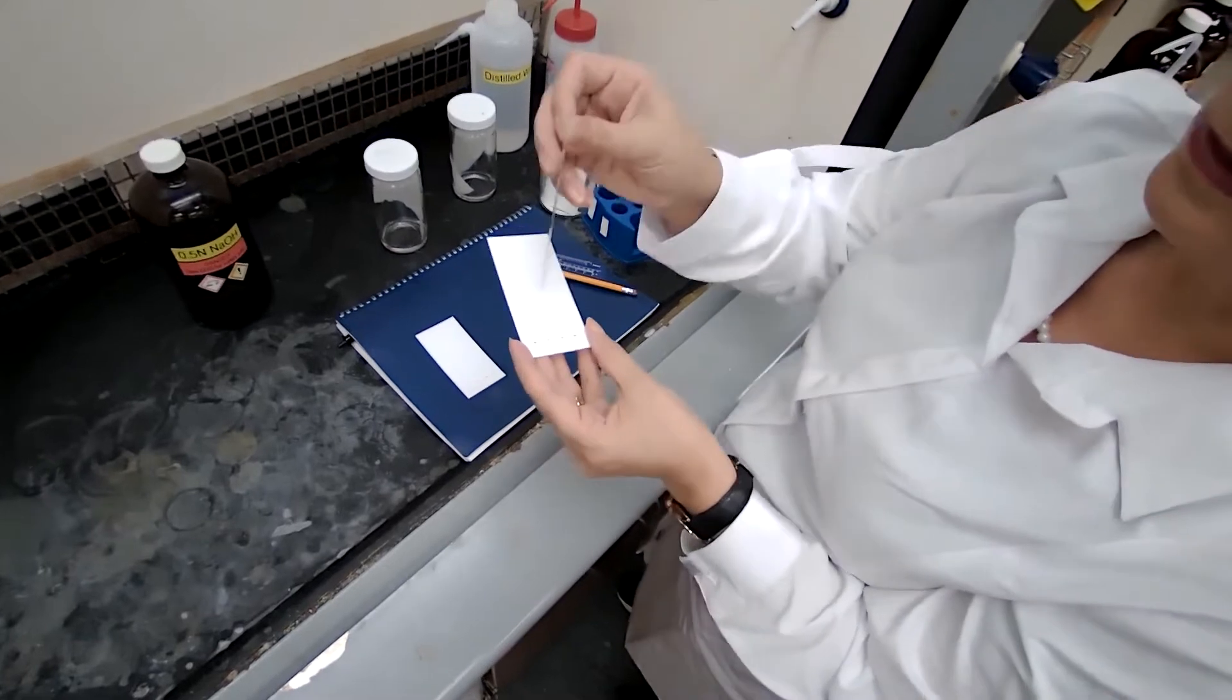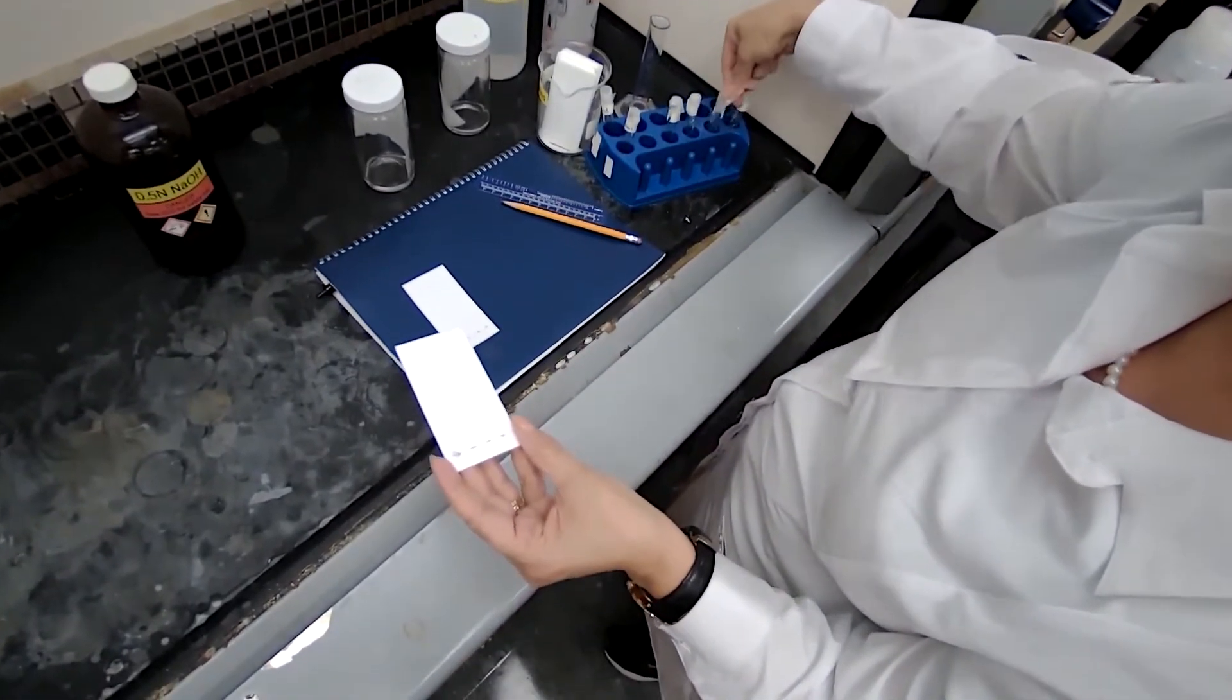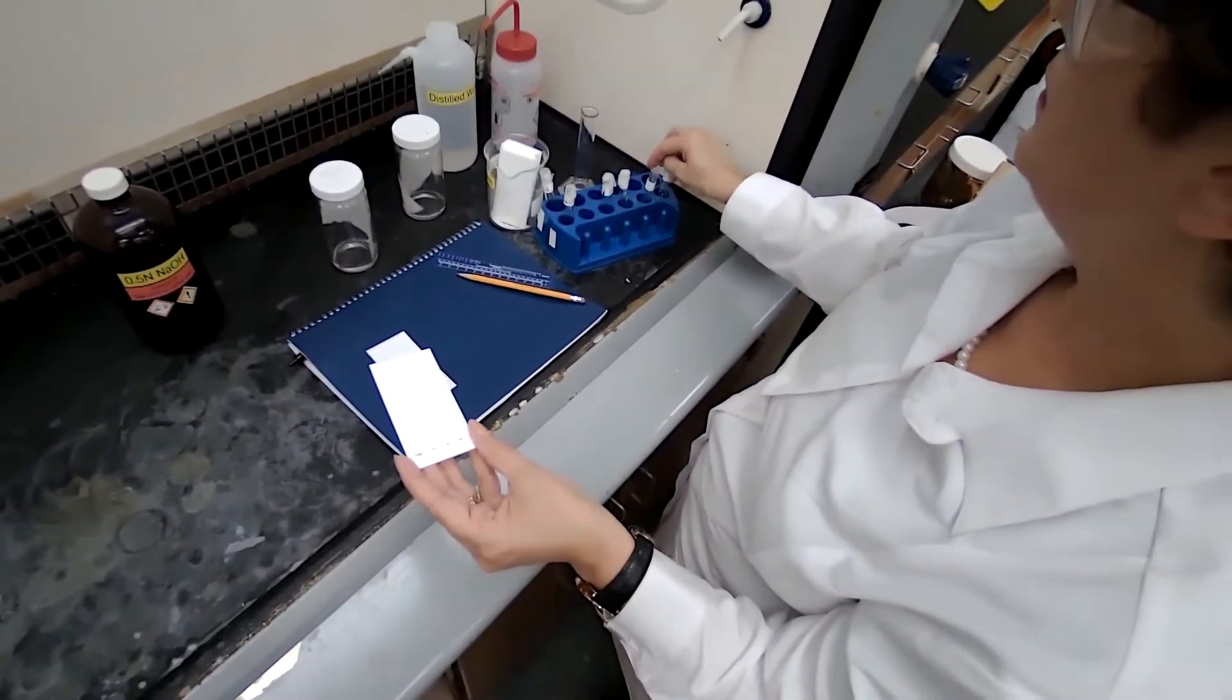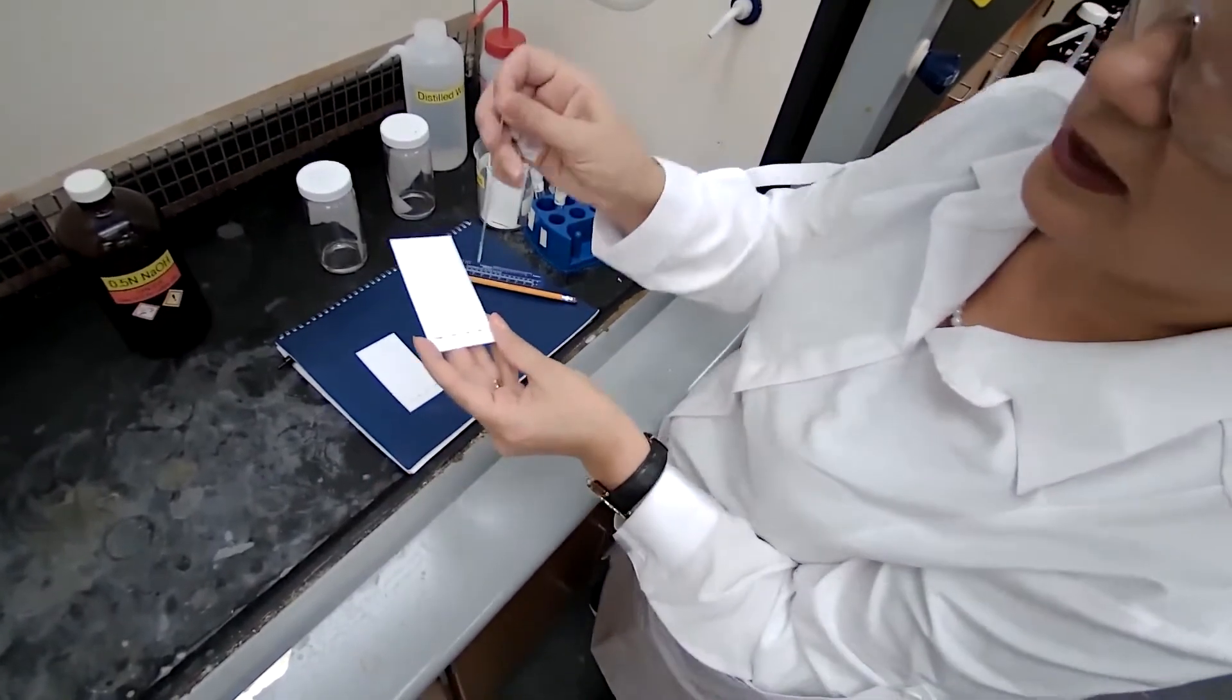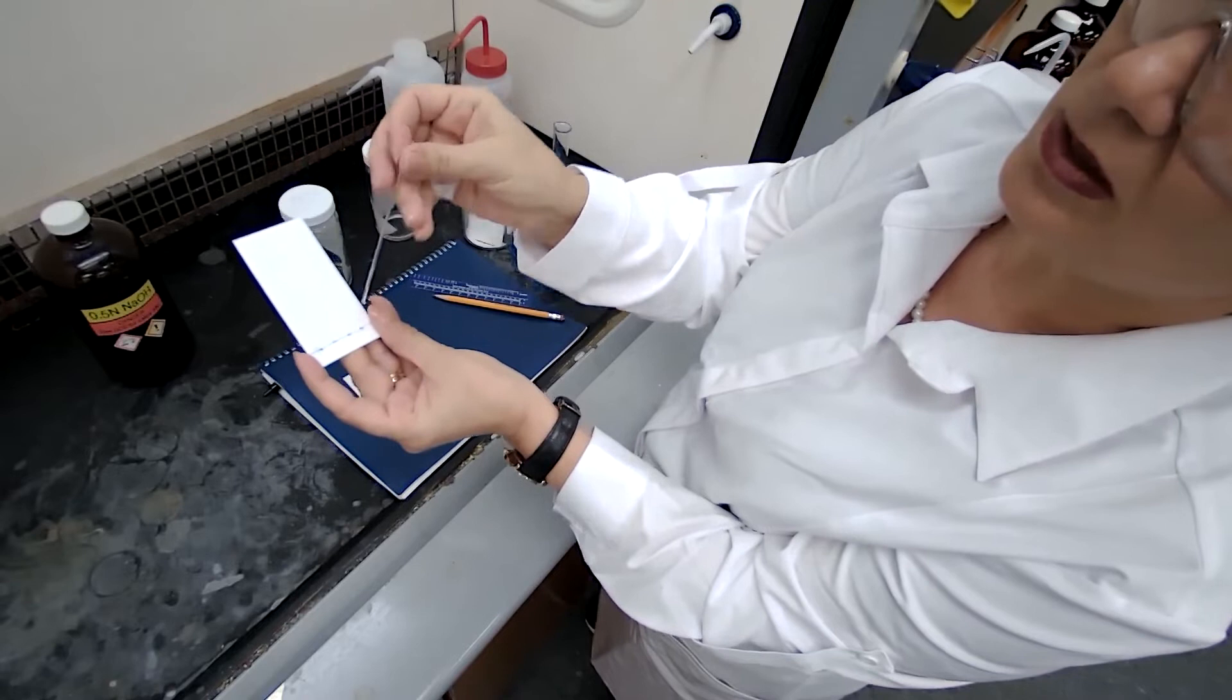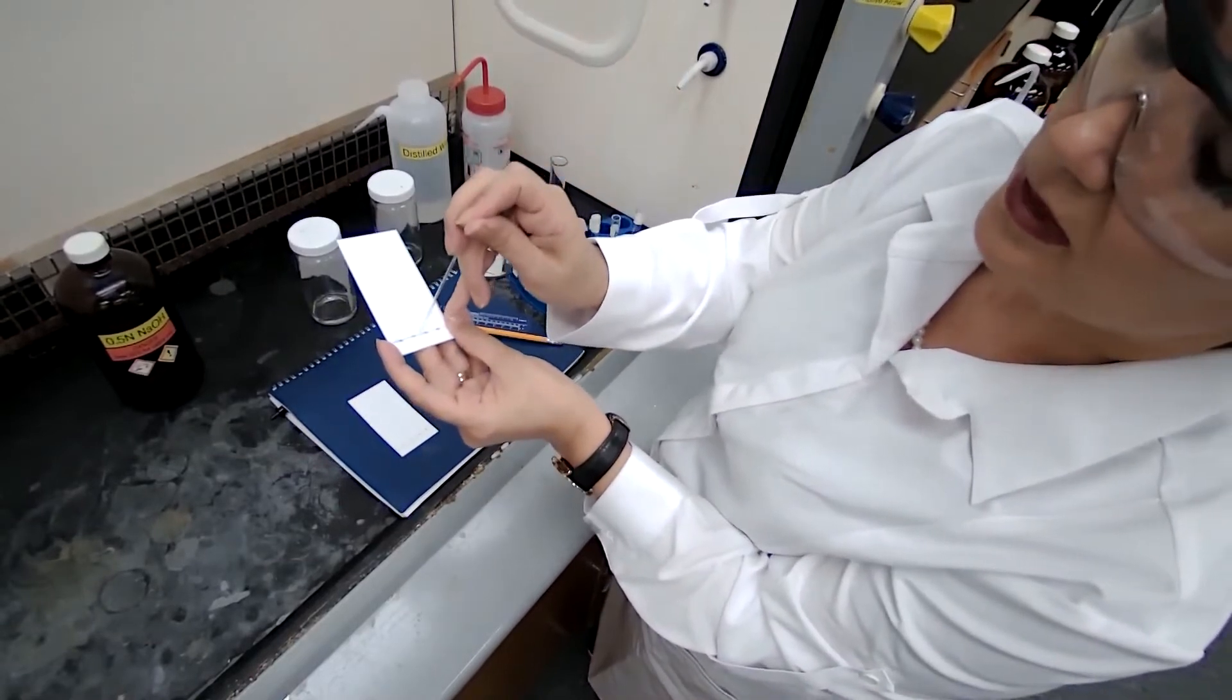You can do that two times to get the desired size of the spot and move on to the next sample. So next sample is going to go on the next spot. You touch once, this small circle that it kind of generates there, you do one more time.